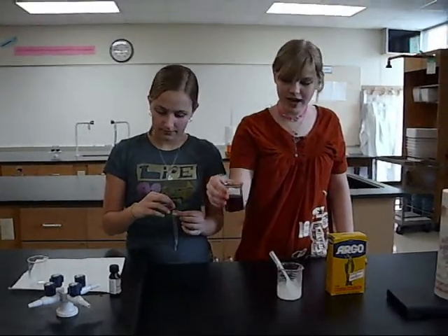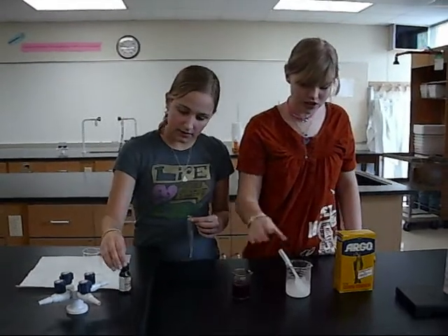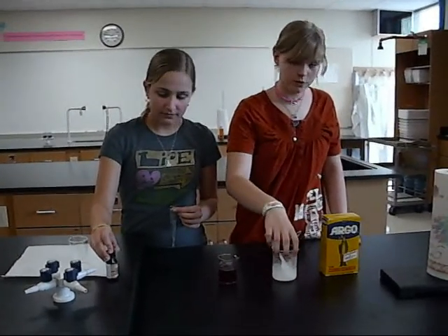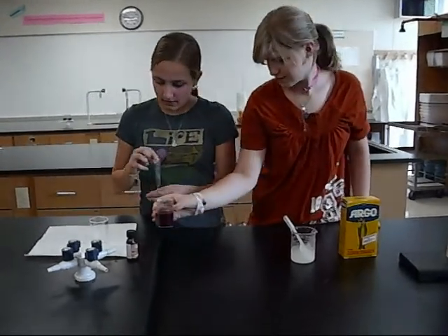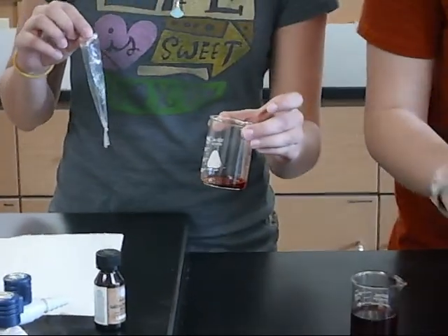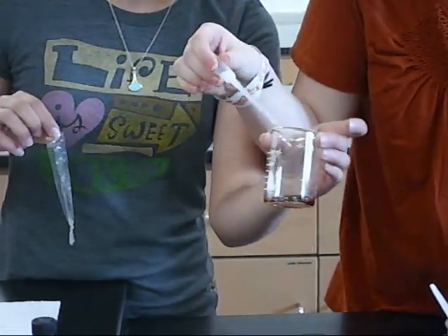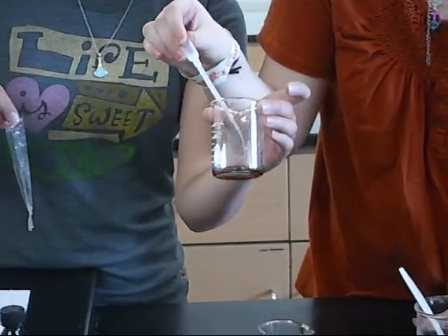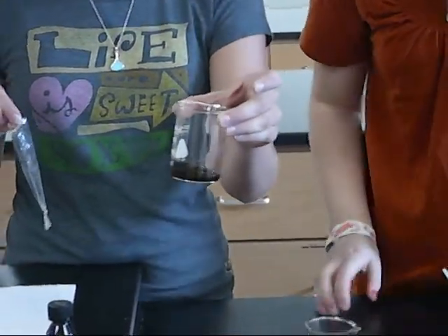So in this lab, we're going to do diffusion. Now here we have iodine mixed with water and cornstarch mixed with water, both of which can be bought in a grocery store or drugstore. And then here we're just pouring a little bit of the iodine, mixed with water, and then some of the cornstarch. And you'll see that it turns a blue color. Okay. Mix it around a little bit.